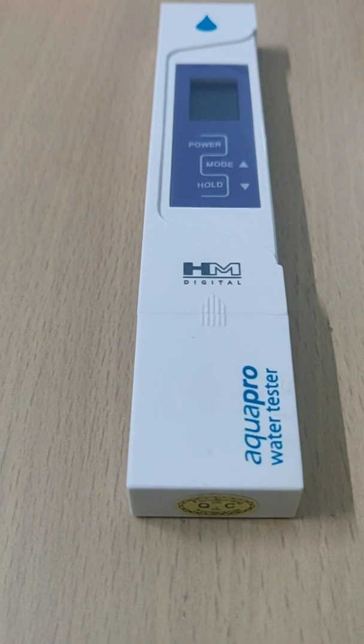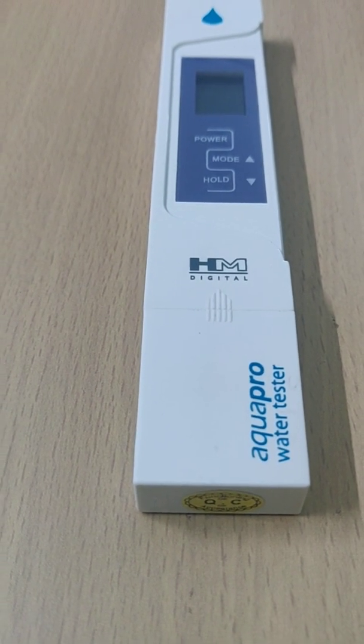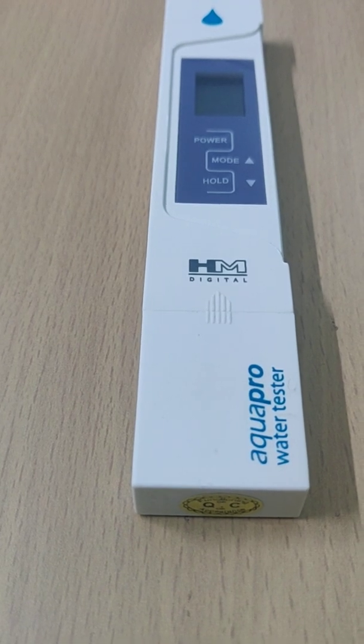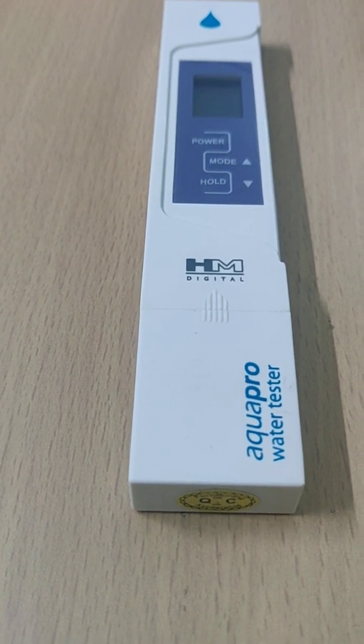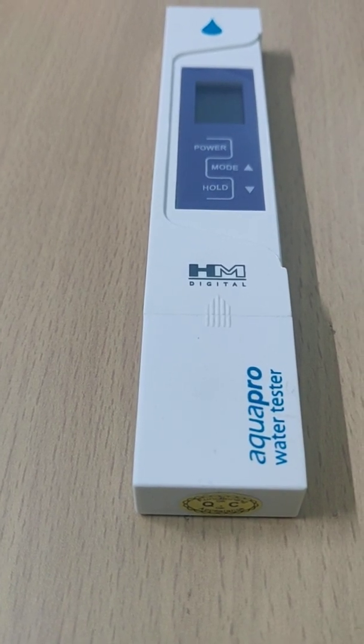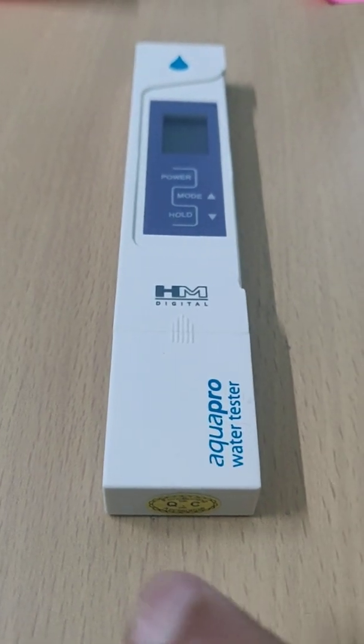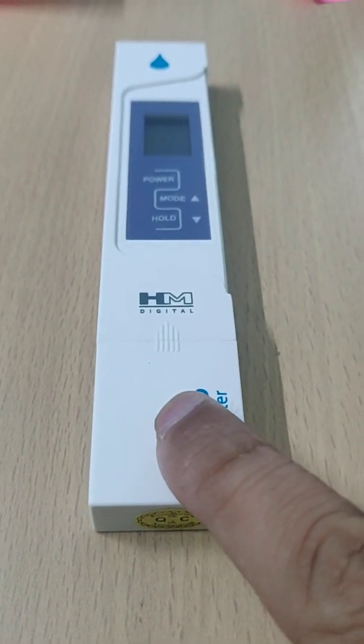In waters, the more water soluble minerals there are, the harder the water. Okay, so whenever you use borewell waters mainly, you will have higher minerals in that, so that can cause problems in the long run. But we just need to know what is the level which is acceptable. So for that, this is the machine which we are using here.